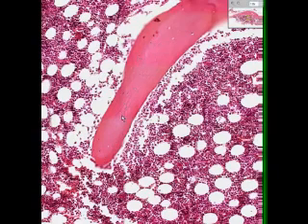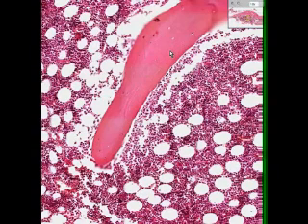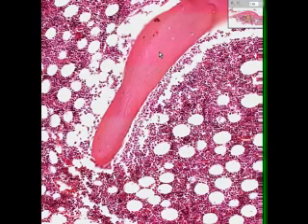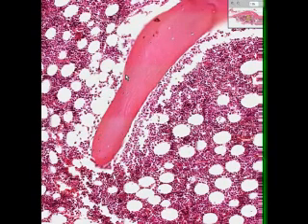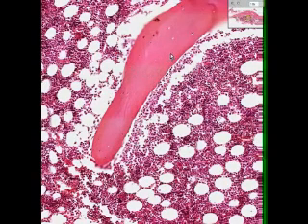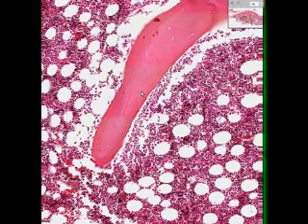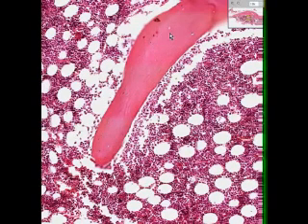There's one, there's one. And then you see these cement lines, which are the crystalline aspect. The membranous bone, or spicular bone, or cancellous bone, or spongy bone, is formed by osteoblasts appearing at the periphery of these spicules, and then being trapped up within the spicule in a lamellar fashion. And that is why you do not see Haversian canals and Volkmann's canals — you see a more concentric or lamellar deposition of bone.